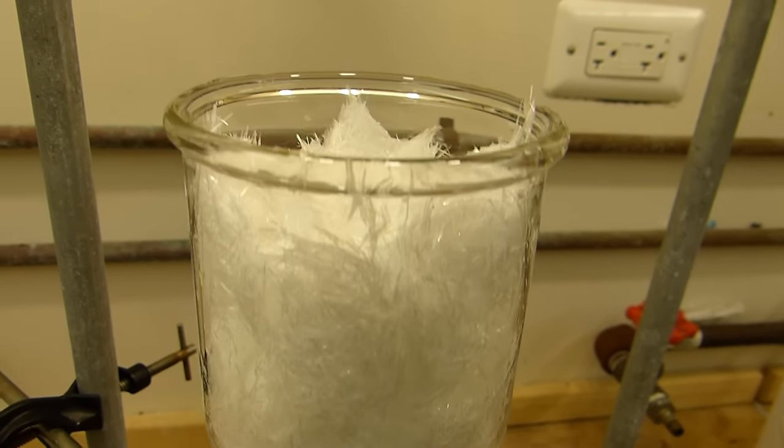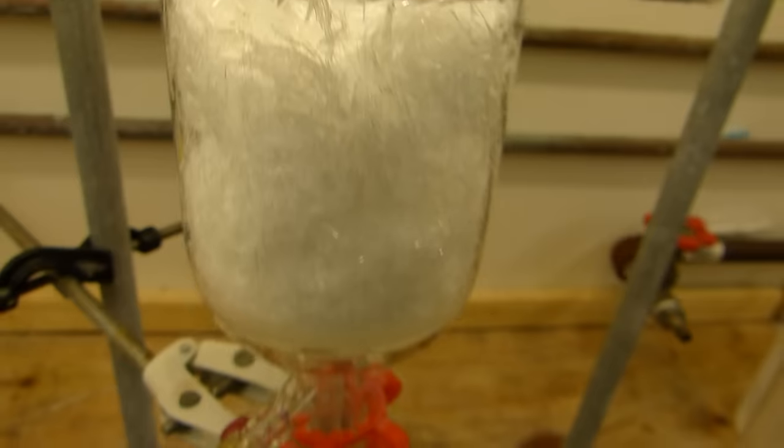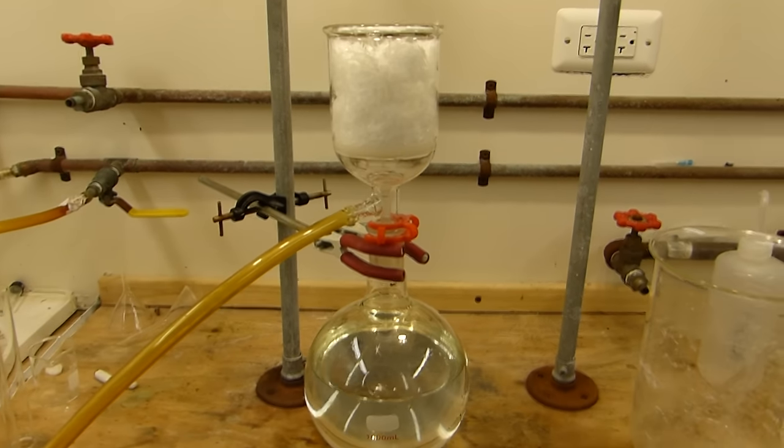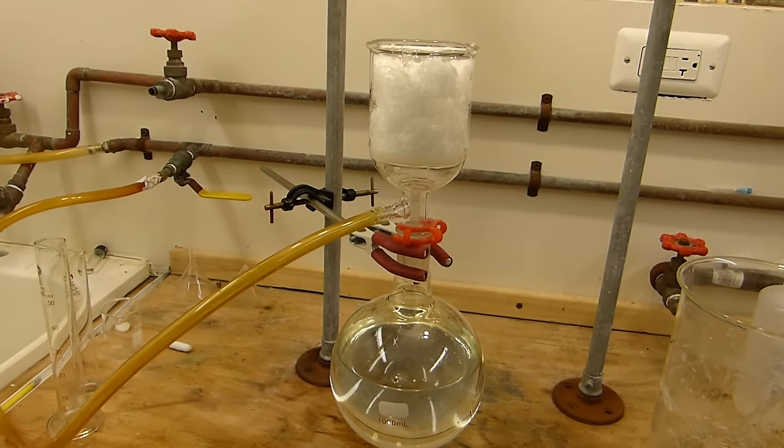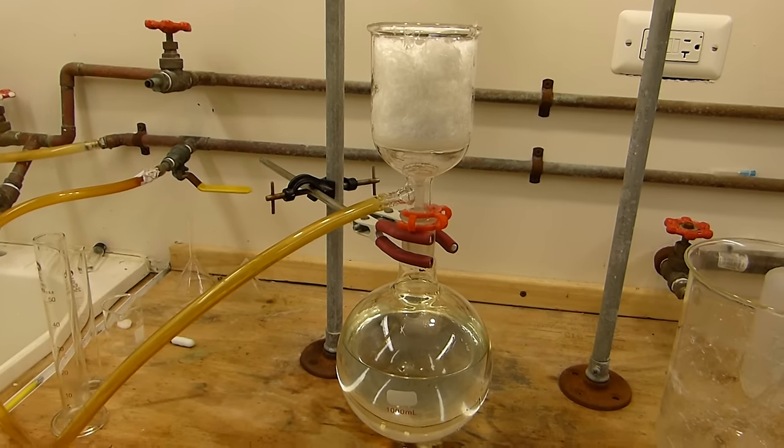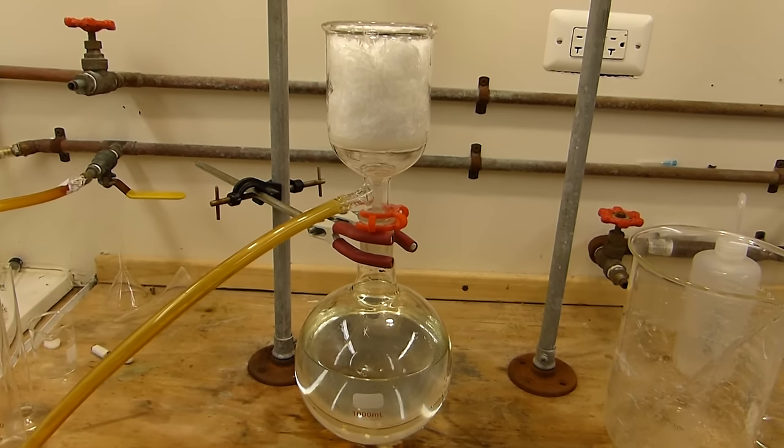There we have some nice crystals of pure benzoic acid. Chemistry sure does look cool sometimes. Anyway, I'm gonna turn the vacuum on, and I'll let this suck the water out of it for a little longer, maybe five more minutes, and then transfer it to the standard drying tray.